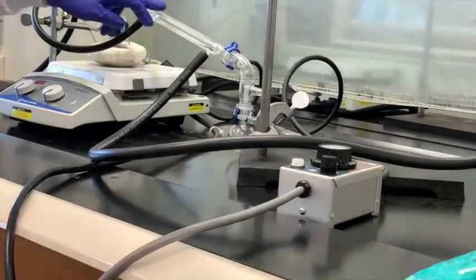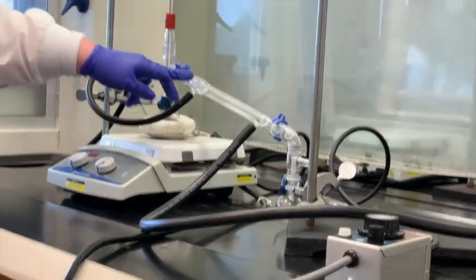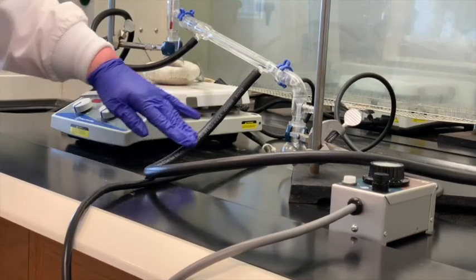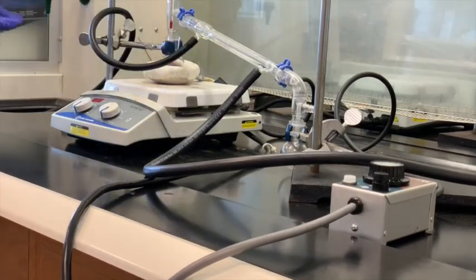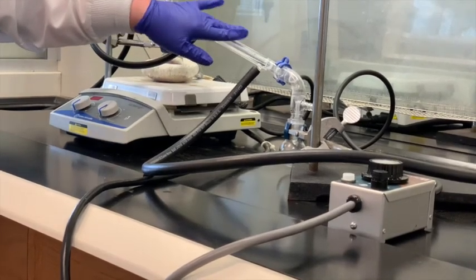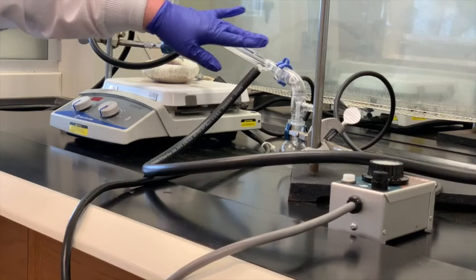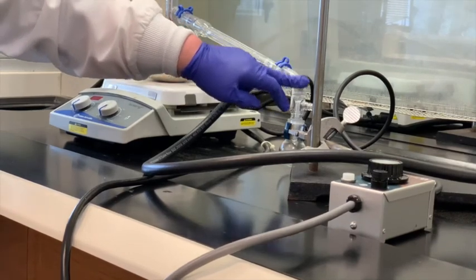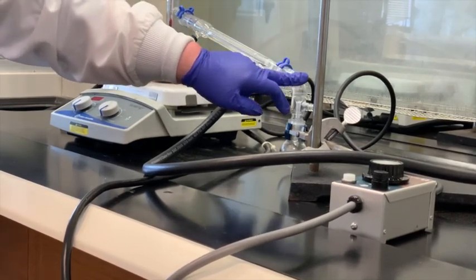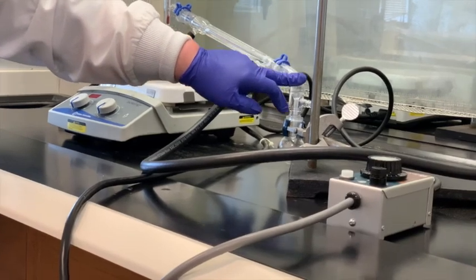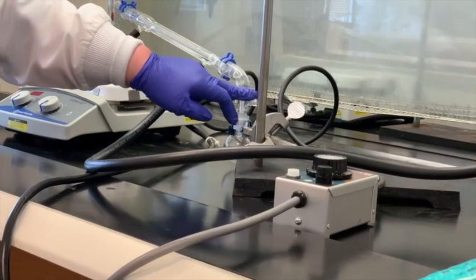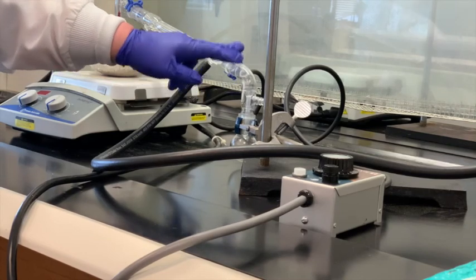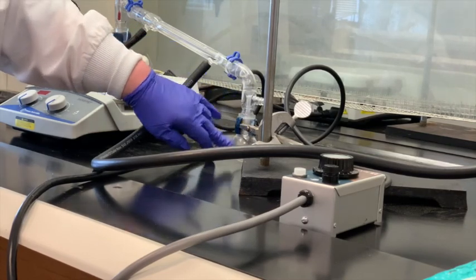We have the condenser, and inside the condenser there is a small hollow tube, and that tube is surrounded by a jacket of which cold water is pumping in and coming out, and there's a reason it's called a condenser. We'll talk about that as the experiment progresses. We have a vacuum adapter attached to the condenser, and we're not using a vacuum source here. If you have something that is fairly high boiling, then it can certainly be to your advantage to hook this up to some vacuum pump that makes the boiling point become lower and easier to distill. We don't have the need for that today, and then this is going to be our receiving flask.